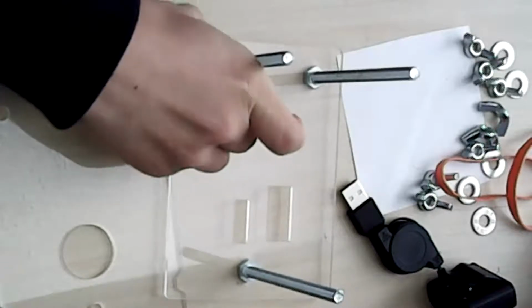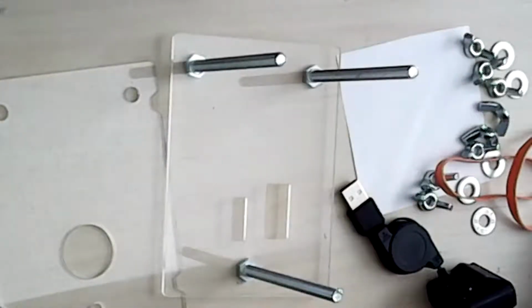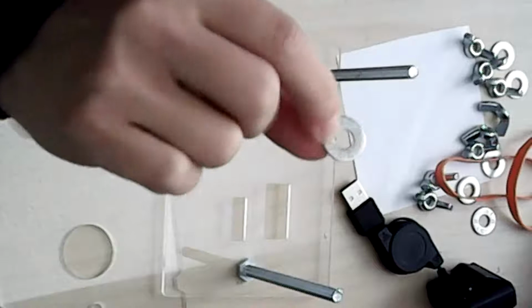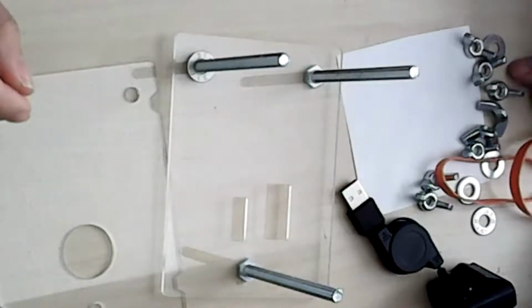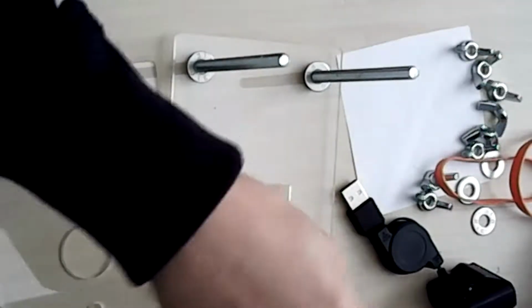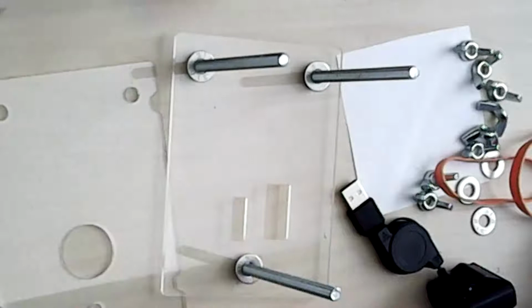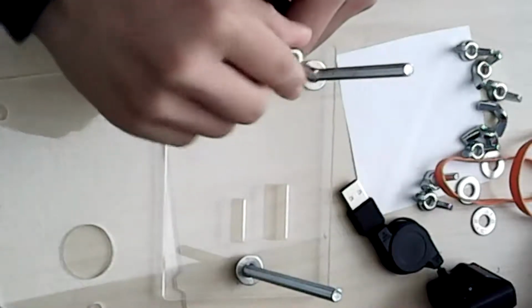And you can also make sure that it's right side up and not upside down. The right side up has some numbers. I don't know what the numbers mean, but it just means that you should put it right side up with the numbers facing up top. And then all you do is screw the wing nuts onto the long bolts.